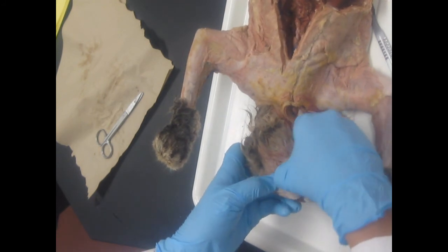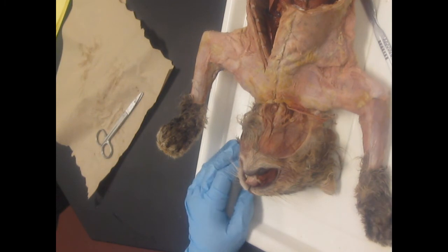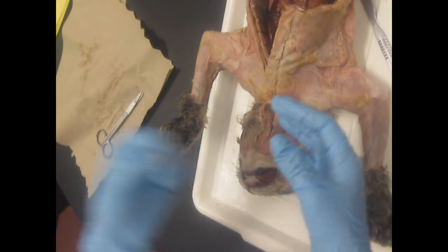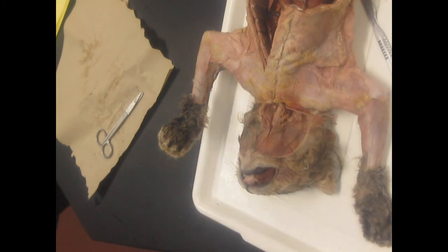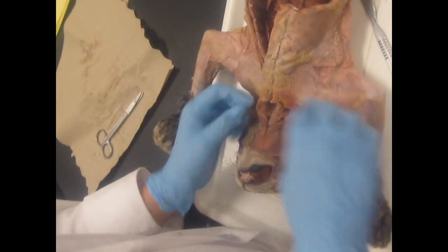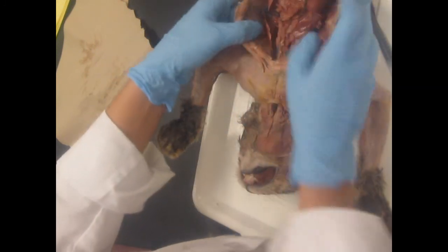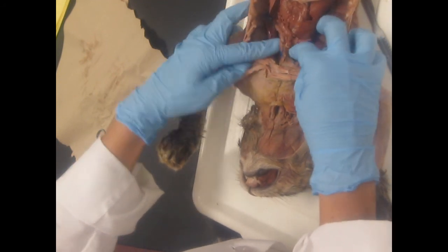If they're yellow with some plaque but not broken, they're about middle age. And if they're all broken and nasty and full of plaque and yellow and brown, you've got a geriatric cat. The older the cat, the less thymus you're going to have. The younger the cat, the more thymus you're going to have. So if you ended up with a cat that's old and you don't have much thymus, walk around the room. Go see other people's thymuses.